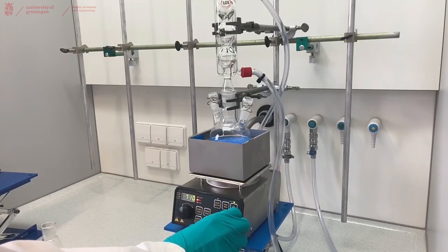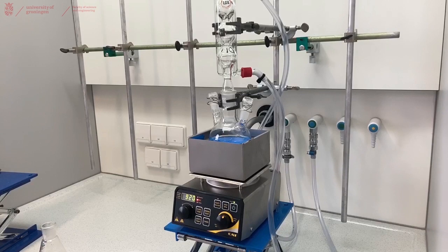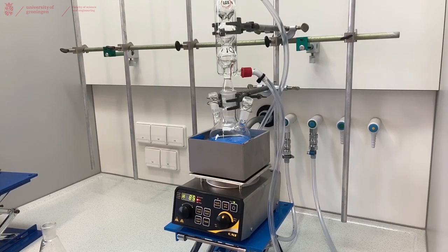Turn the motor on so that it will stir, hopefully start stirring our stir bar, and then we'll just wait until it starts boiling and everything starts dissolving.